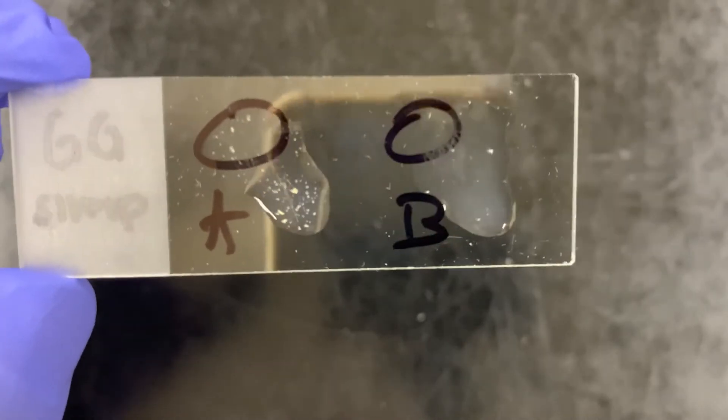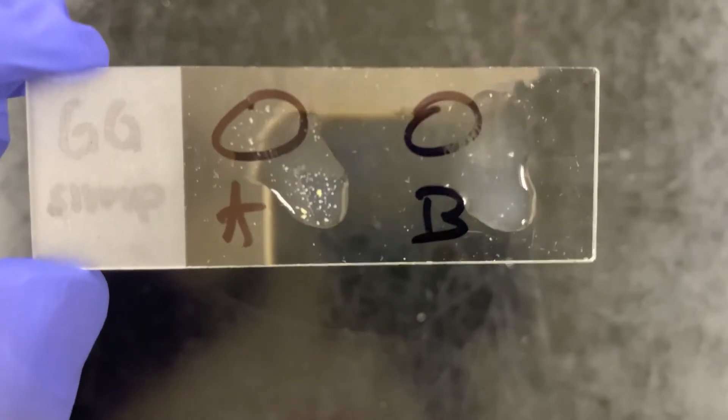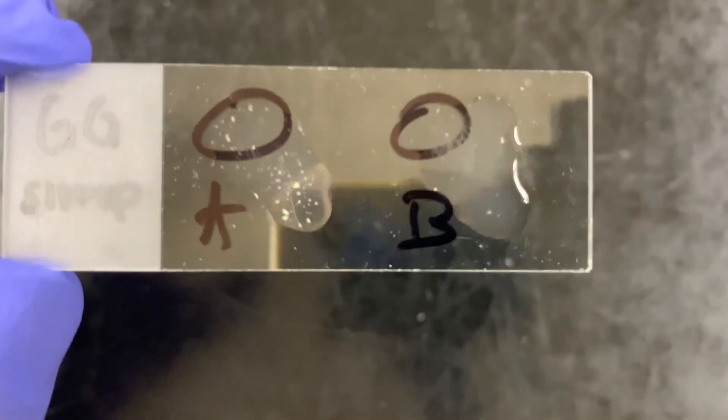Sometimes it's a little bit confusing because the bacterial clumps — pieces of the colony — are kind of floating around and they look like clumps. But you can see how the liquid on the left is starting to clear up: all the proteins in the plasma are clearing and you're left with these clumps. Whereas for B, even though you see those clumps — which are probably just chunks of the colony floating around — the liquid still remains cloudy. So that indicates that's not true coagulation; that's just stuff floating in the plasma.